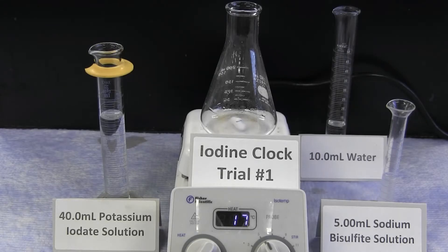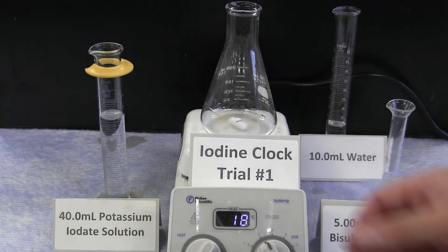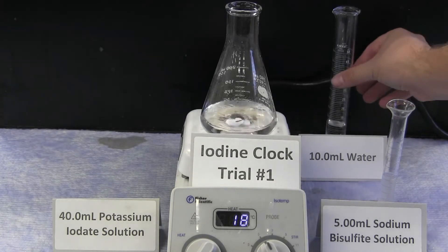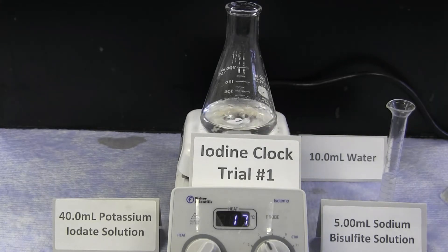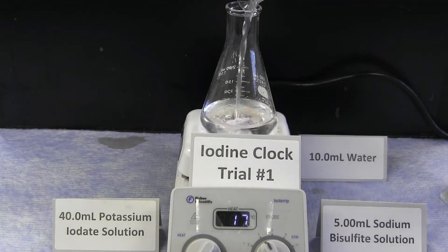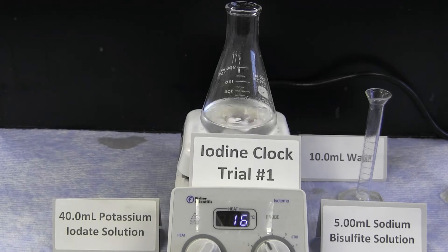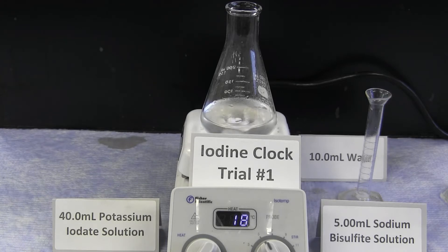The next reaction set lowers the total final concentration of potassium iodate by combining 40 milliliters of the potassium iodate solution with 10 milliliters of water, after which the same amount of 5 milliliters of sodium bisulfite solution is added. This decrease in concentration of a reactant will cause an increase in the reaction time.